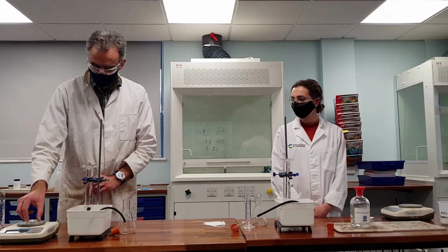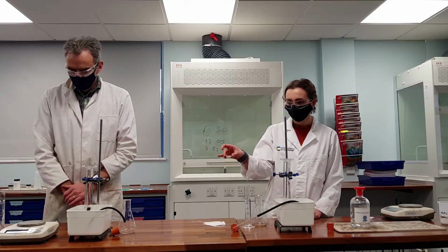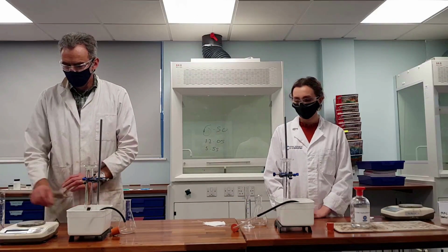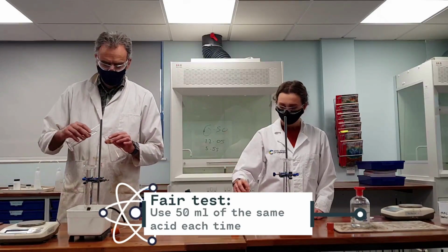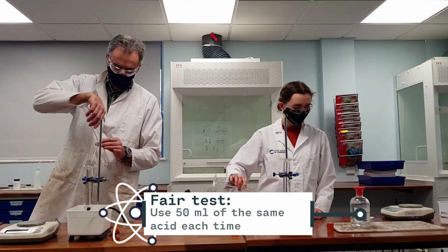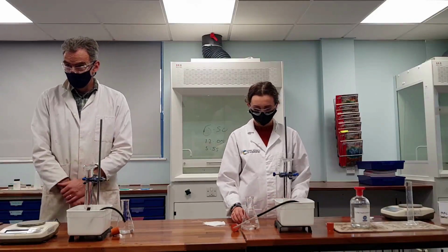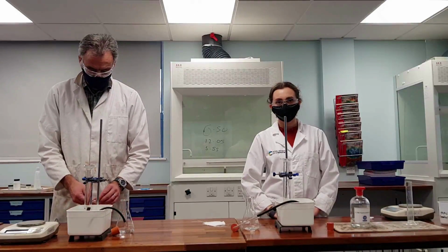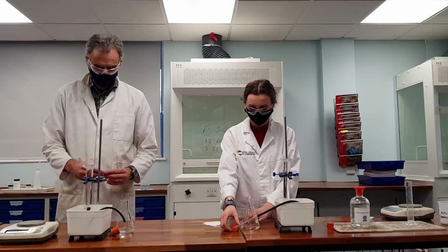So Mr. Reeves has got specially small weigh boats that will fit down the neck of the conical flask. So first we're going to measure out our hydrochloric acid. We've done the calculations, and 50 millilitres of acid should be more than enough to react with all the limestone. Actually, we worked out about 10 millilitres is enough to react, even if the limestone is 100% calcium carbonate, so there should be no problem with the acid running out.